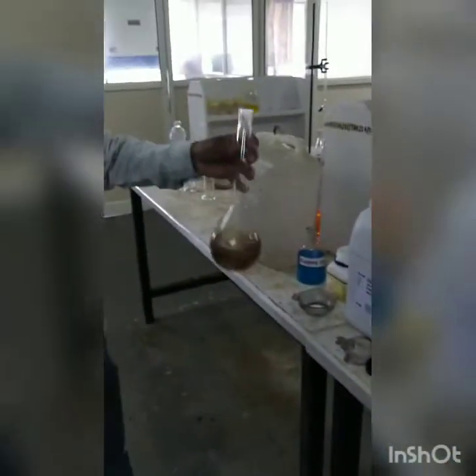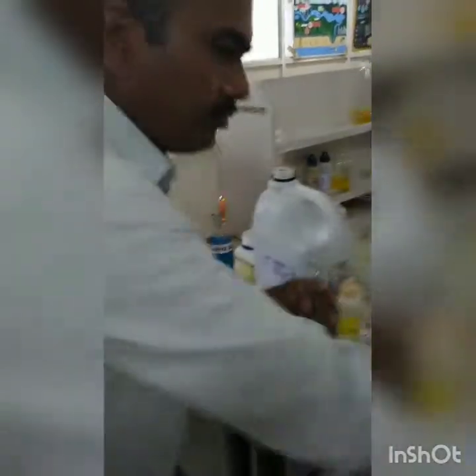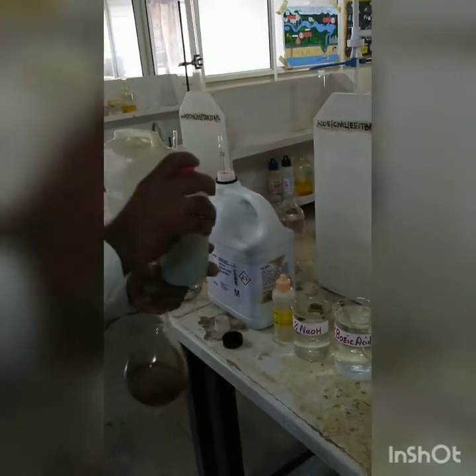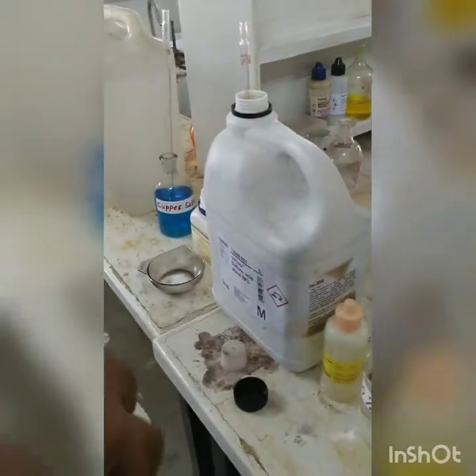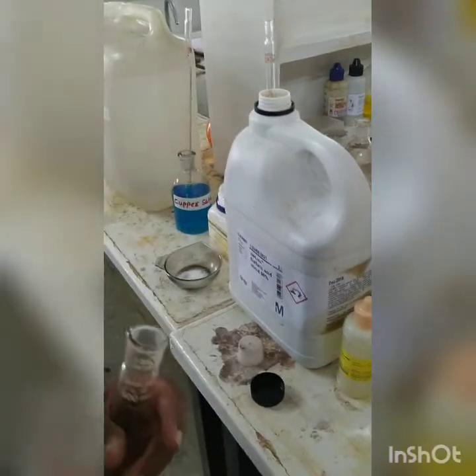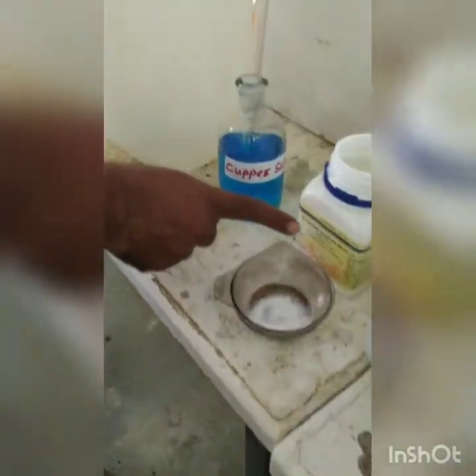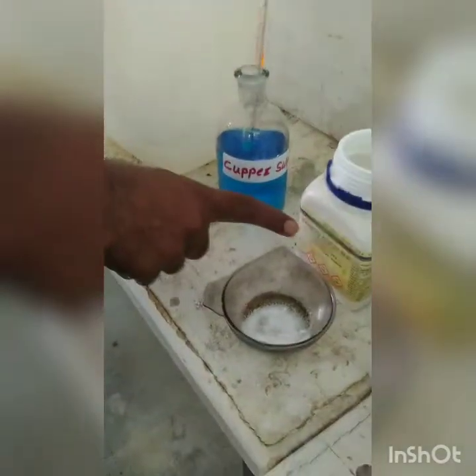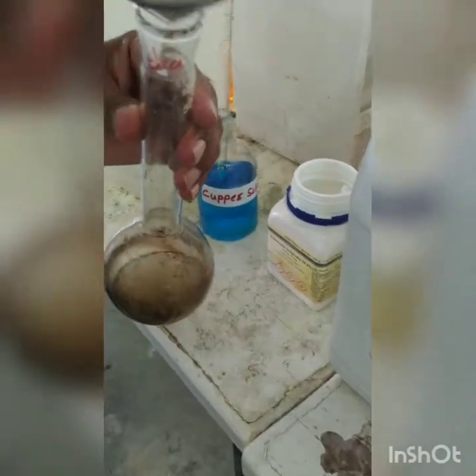Okay. So we are going to add few glass beads now. Glass beads, and we are also going to add 1 spatula of potassium sulfate, that is about 5 grams of potassium sulfate. And as we had done in COD experiment, so these glass beads are used while heating to avoid bumping, and this is 5 grams of potassium sulfate. So it is being added. It is added. So we are adding 5 grams of potassium sulfate.